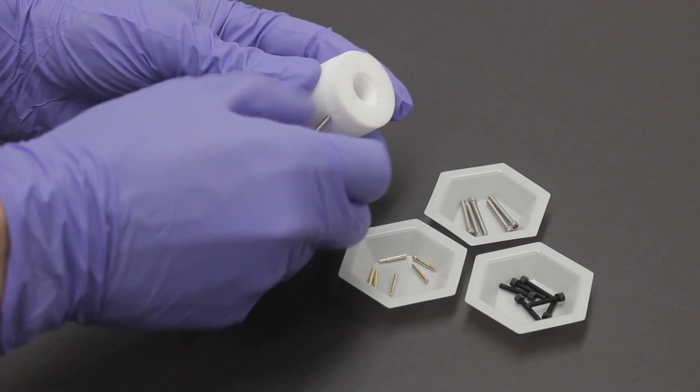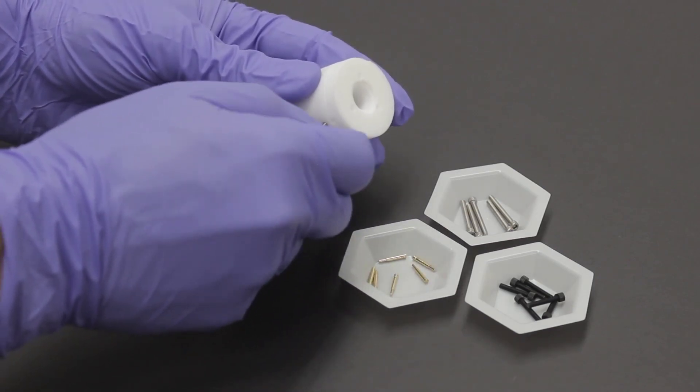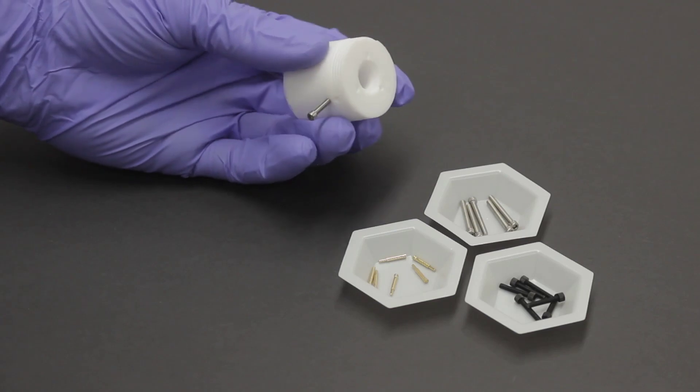Tighten the screw until it bottoms out, but be careful not to tighten beyond this point, or else the threads may be damaged.